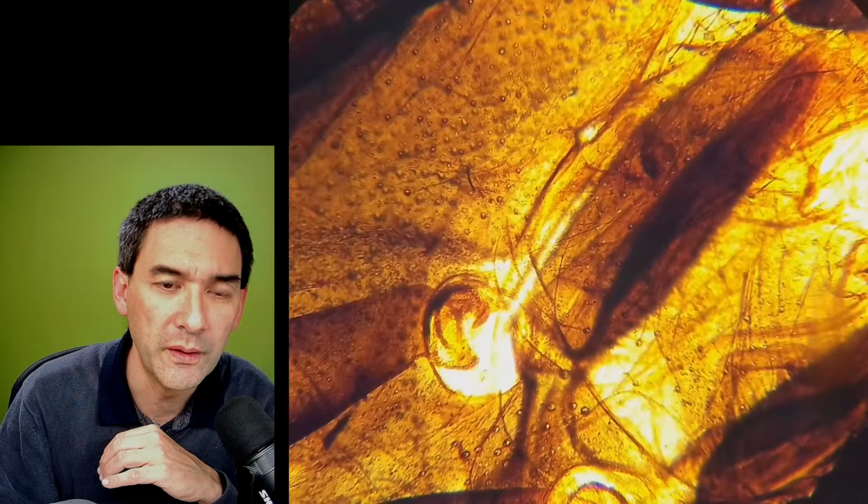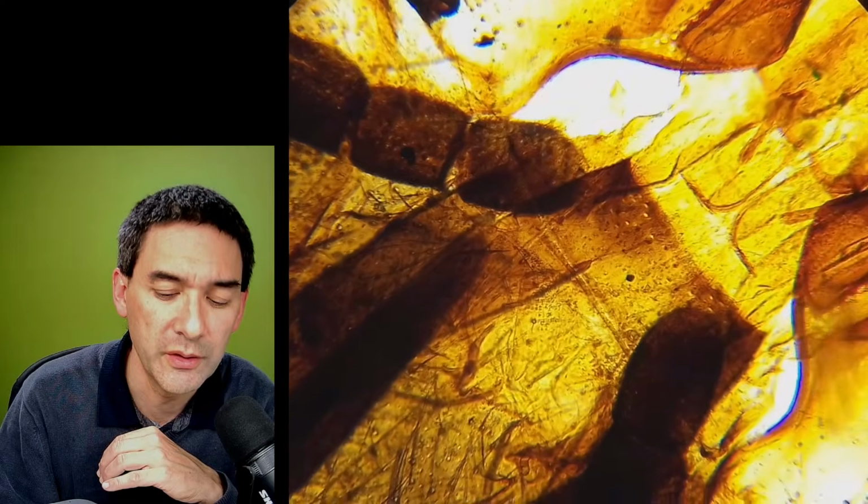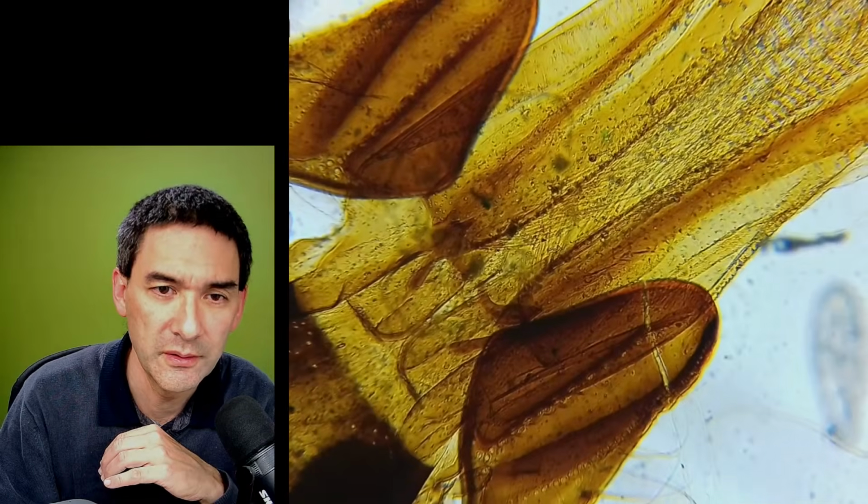On the other end here, right here on the corner, you see that it's kind of white. So that's stray light, and that's always generally an issue with cheaper microscopes. But over here it's better.